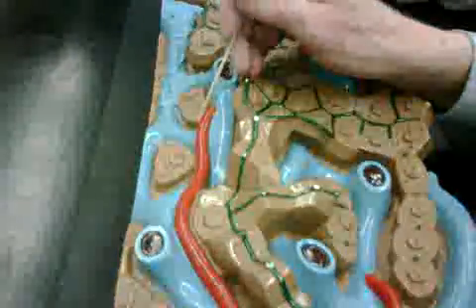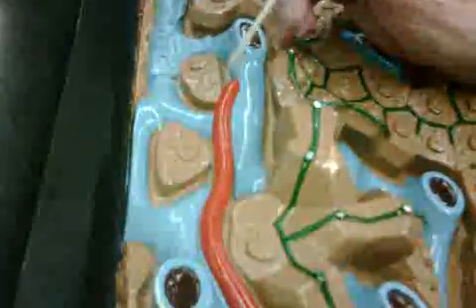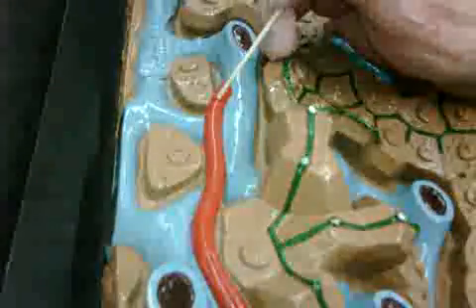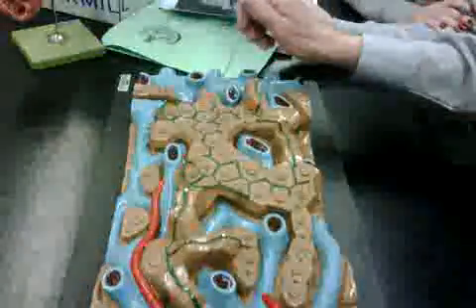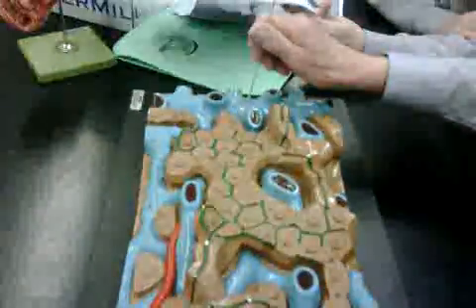And all that blood, oh, and incidentally, where artery meets vein without benefit of capillaries in between, we call that an anastomosis. So this is an arteriovenous anastomosis. That's where an artery meets a vein? Yeah, without any capillaries being in between. So that the arterial blood drains directly into the sinuses. All right? All that blood sweeps through in this direction and enters the central vein.